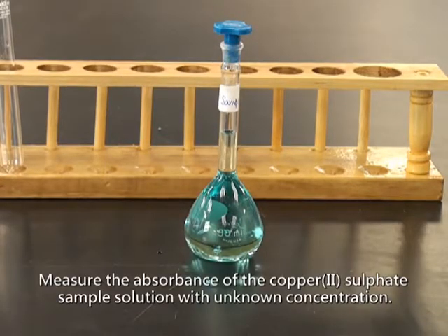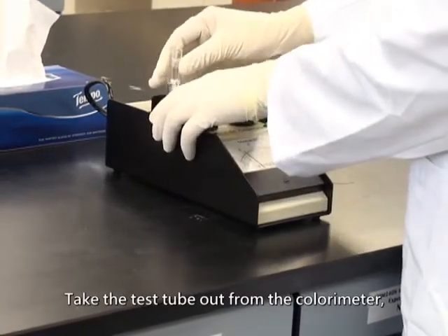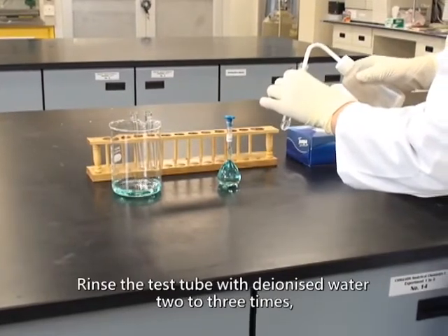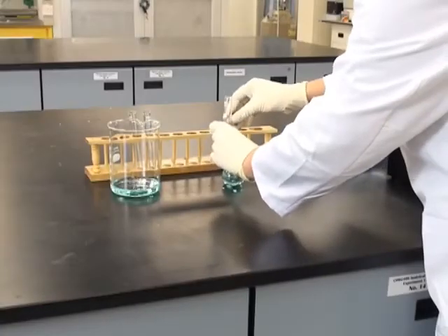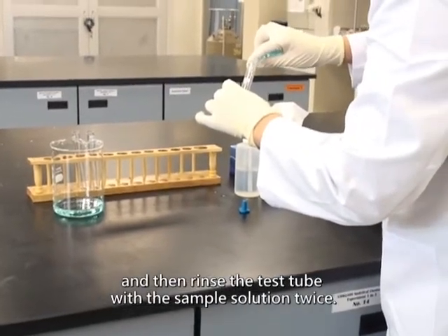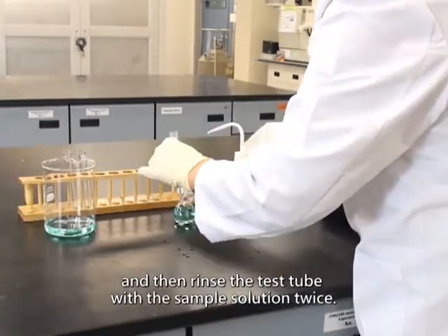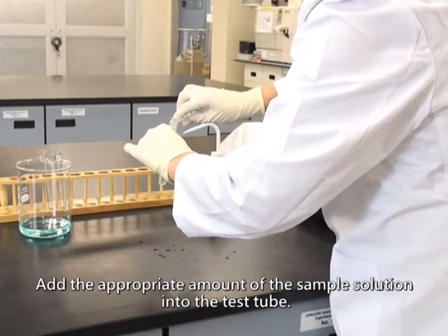Measure the absorbance of the copper(II) sulfate sample solution with unknown concentration. Take the test tube out from the colorimeter and discard the content in the tube. Rinse the test tube with deionized water 2 to 3 times. And then rinse the test tube with the sample solution twice. Add the appropriate amount of the sample solution into the test tube.